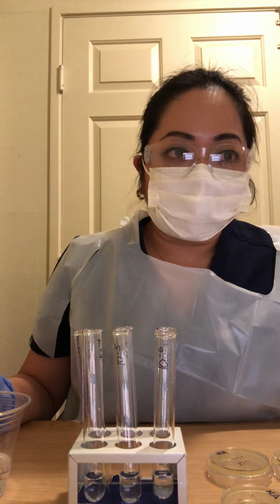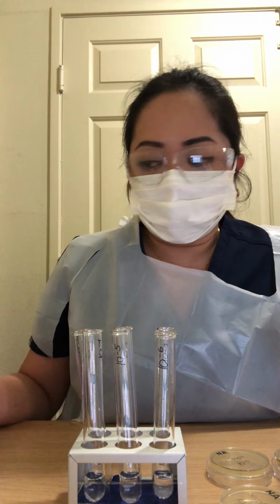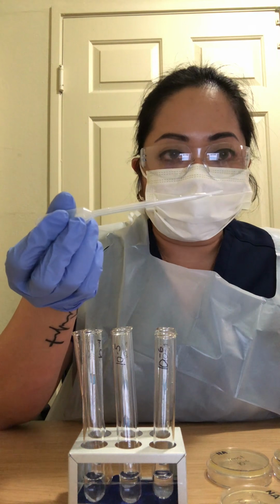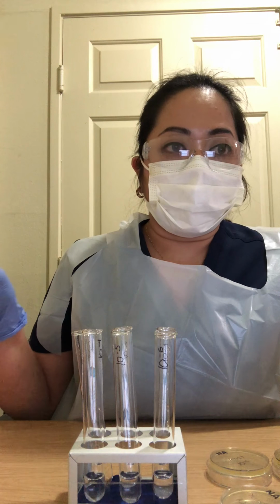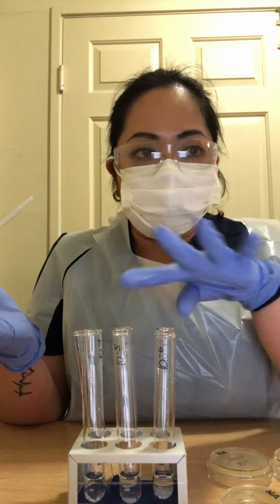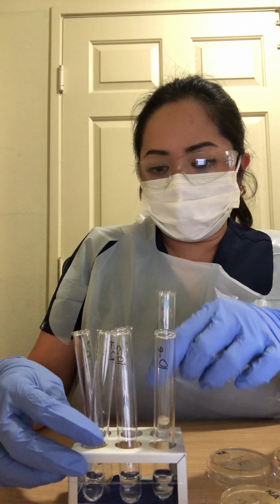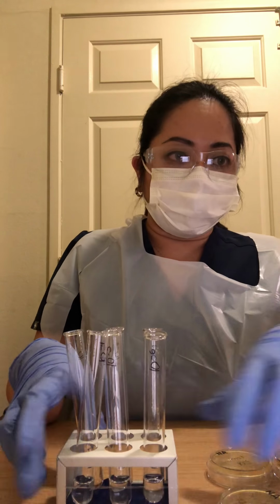So to begin, we have to sterilize our graduated pipette by drawing a small amount of alcohol into the bulb of our pipette. After 20 seconds, you have to expel the alcohol into the sink, making sure that there's no alcohol remaining inside the pipette, making sure that it's dry. And then once it's dry, you have to add 2.25 ml to each tube. I already did that earlier. So I have 2.25 ml in 10-1, 2, 3, 4, 5, and 6. Everything has 2.25 ml.